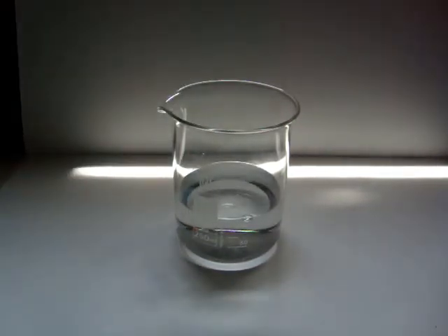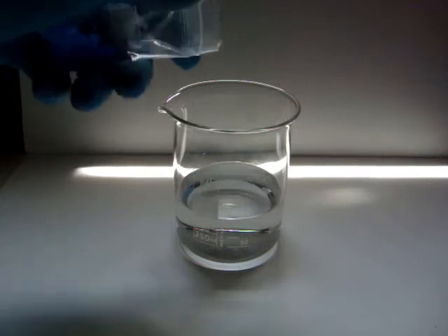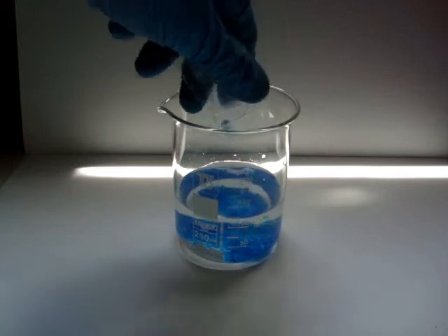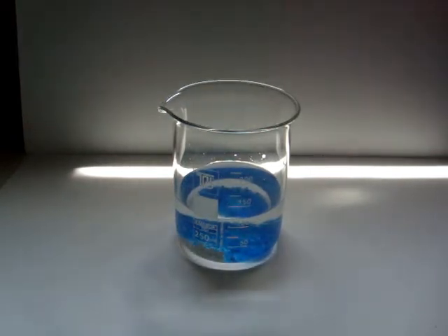Now add about 8 grams of copper sulfate pentahydrate. Mix until it is completely dissolved.